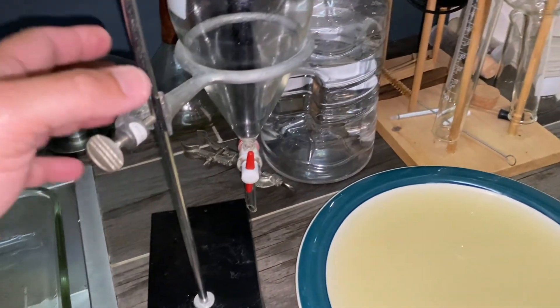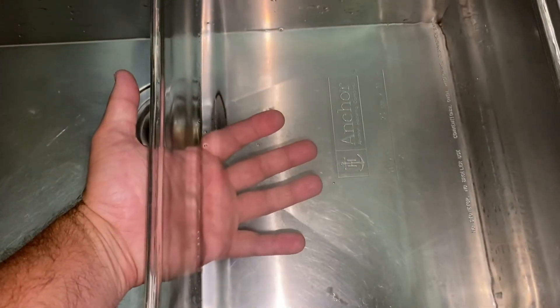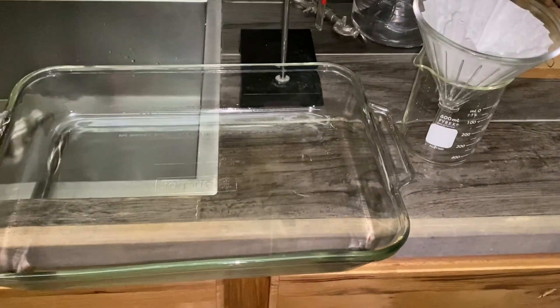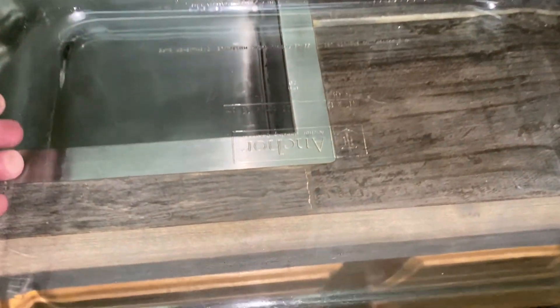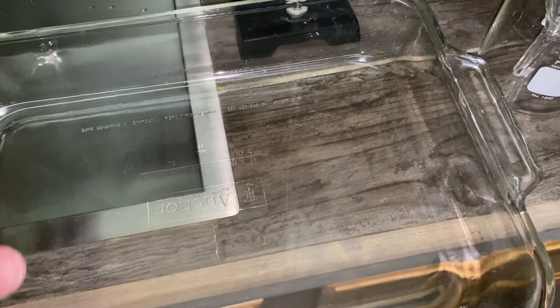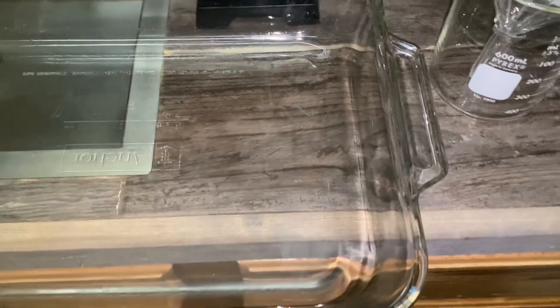I've drained this off and everything's looking good — it's nice and clear. We're just going to let it dry out and see what we get. I decided to filter this because I noticed some very fine particulates. Since CBG is alcohol soluble, I figured I could filter it through and then add a little extra ethanol to rinse it off and run it through a filter.